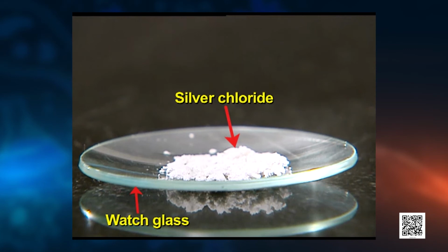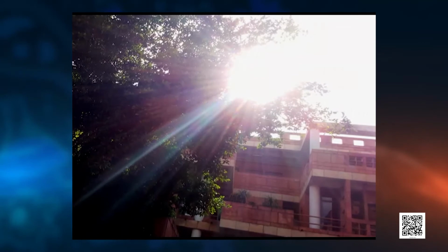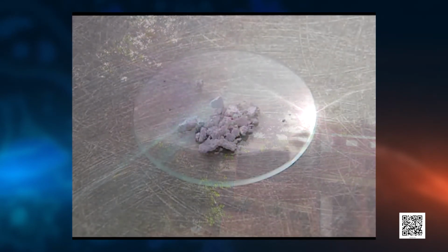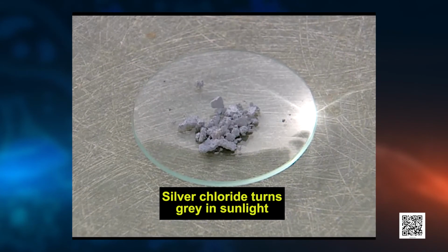In this video, you can see we have taken 2 gram silver chloride in a watch glass. What was its color? Yes, it was whitish. And it is placed in sunlight for some time. After some time, what changes do you observe in the color of the silver chloride? Silver chloride turns gray in sunlight to form silver metal.